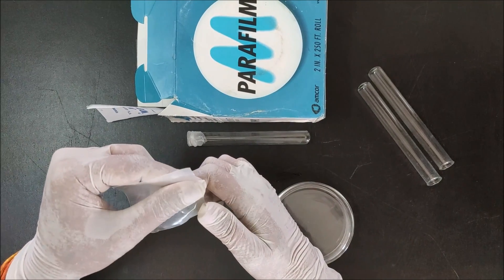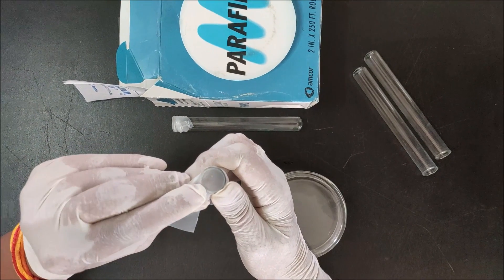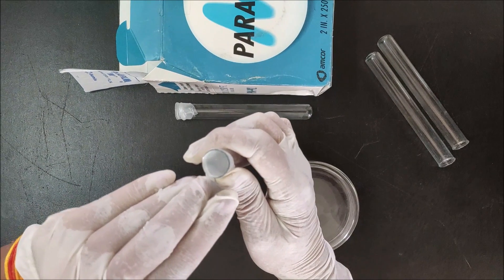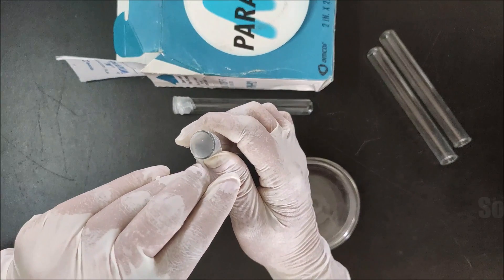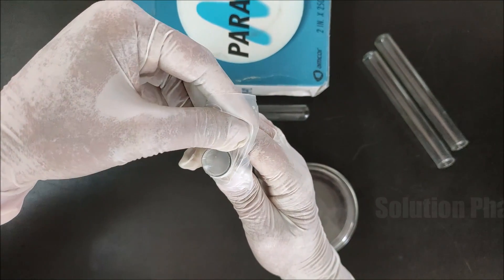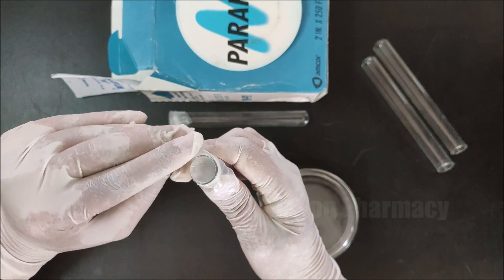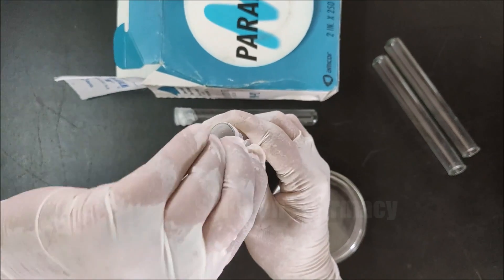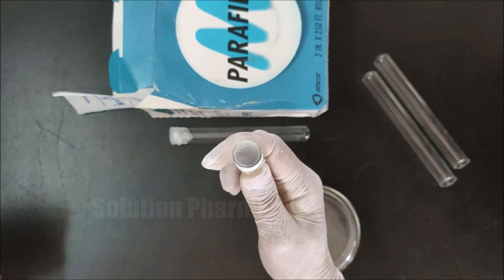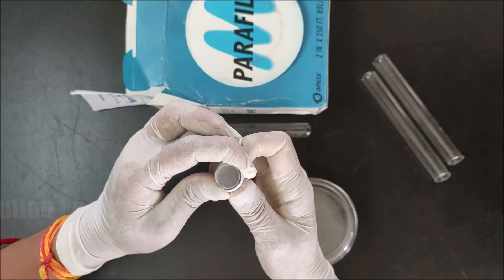Stretch, twist, and rotate the parafilm around the edges of the test tube. Repeat this stretching and rotating multiple times to make a tight seal around the edges of the test tube, ensuring liquid-proof sealing.